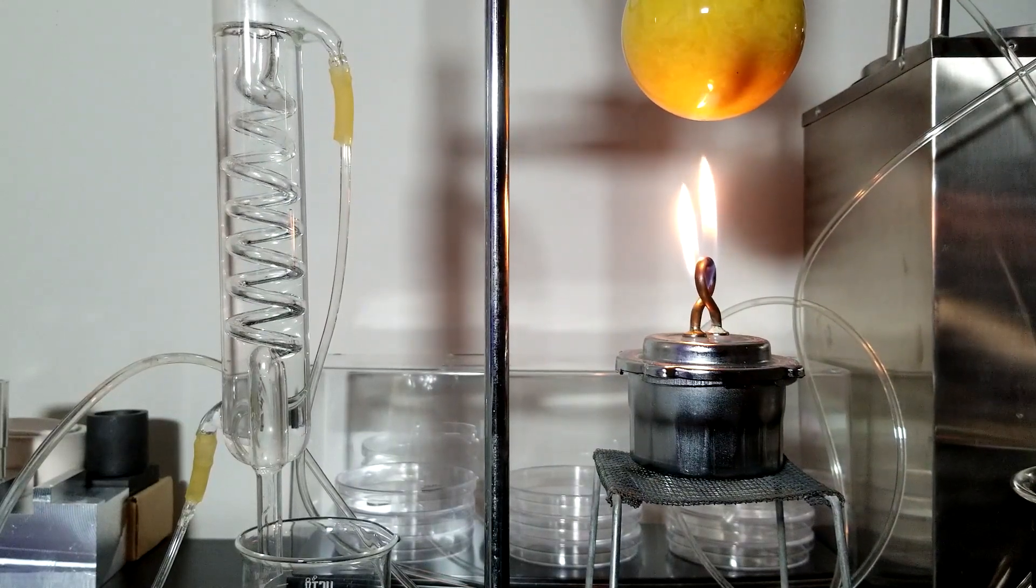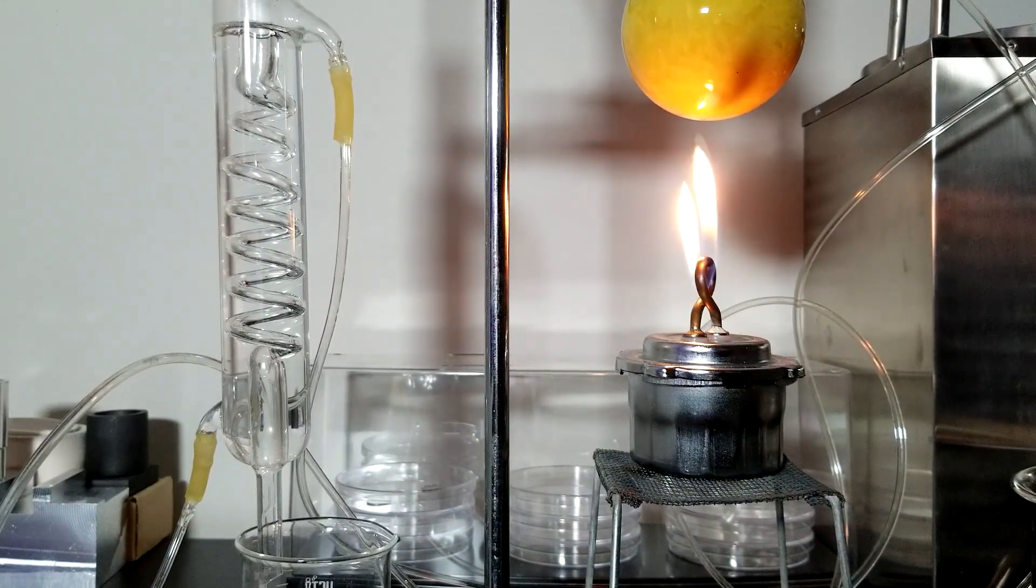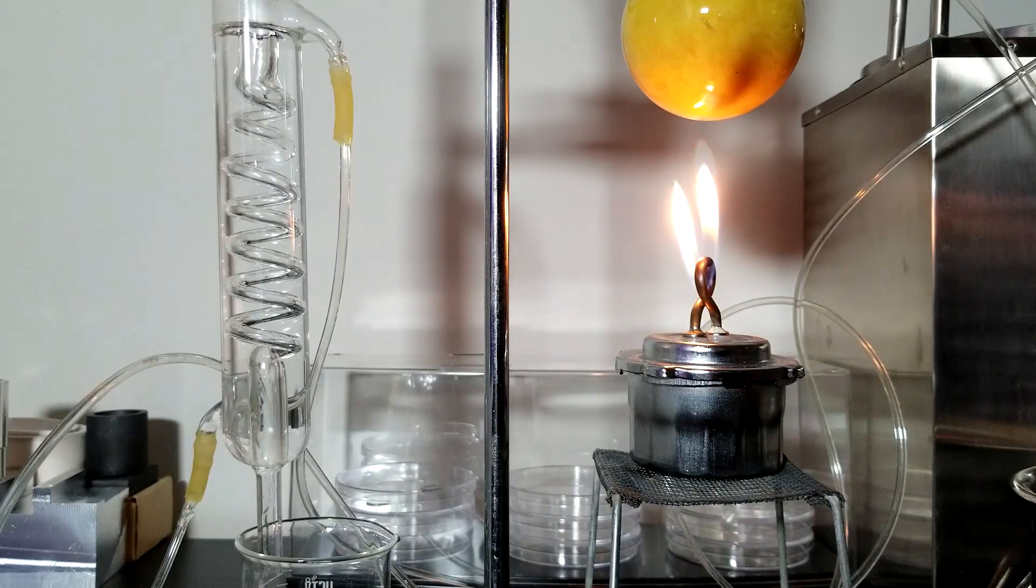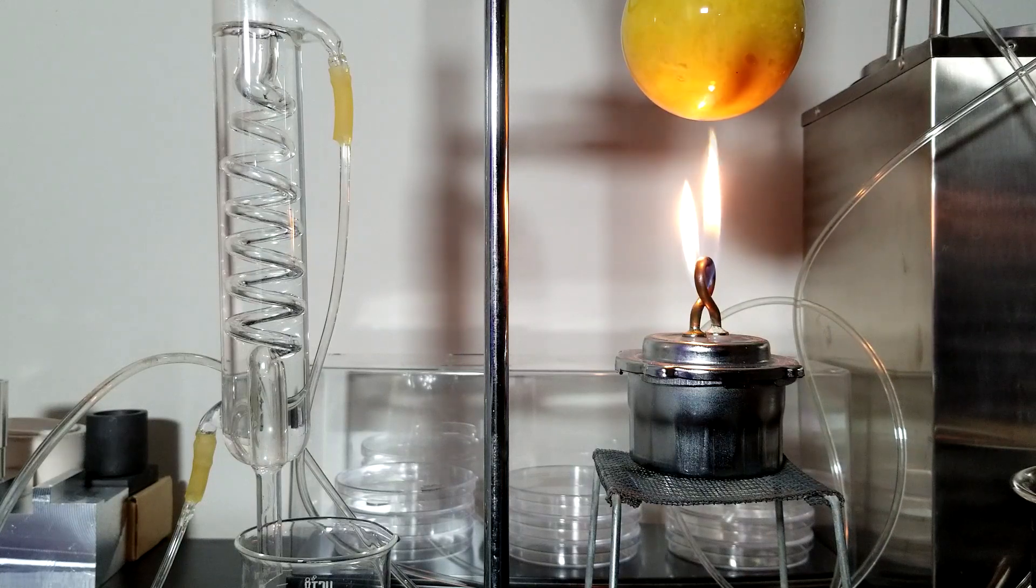But in the end, we didn't have a problem with that, so I let the process continue. Now you can see that the content is boiling and the steam carrying the essential oil is condensed in the condenser, forming droplets.